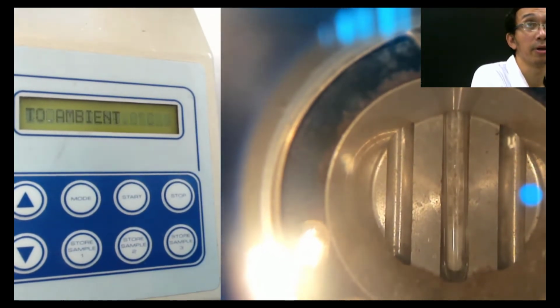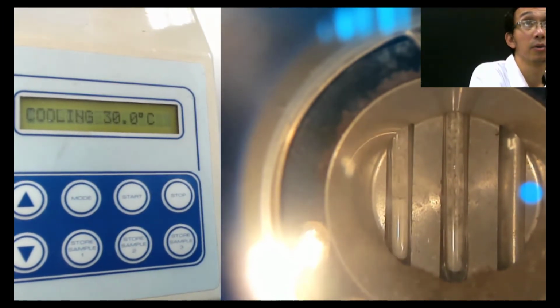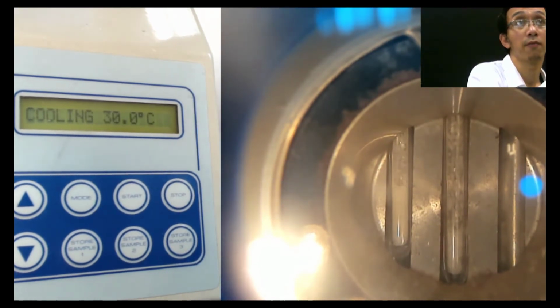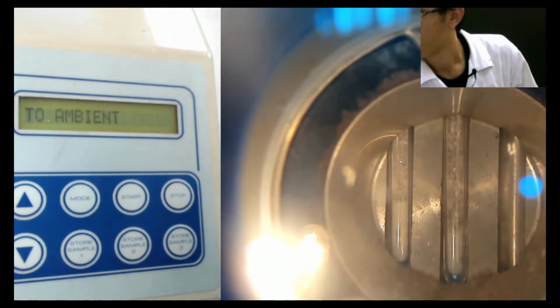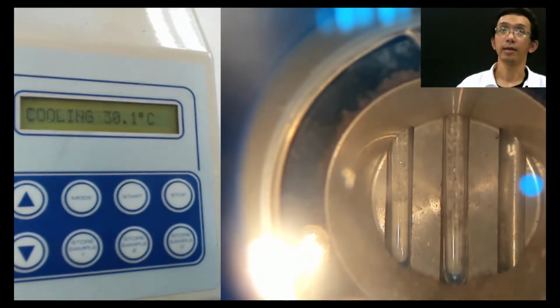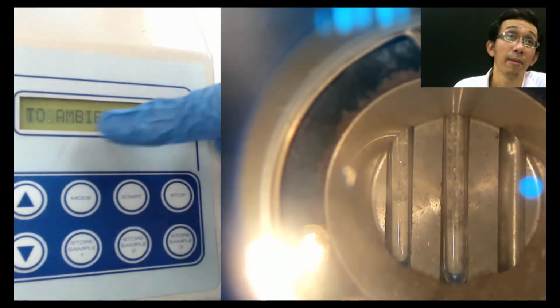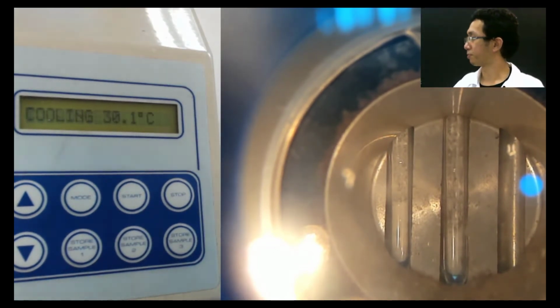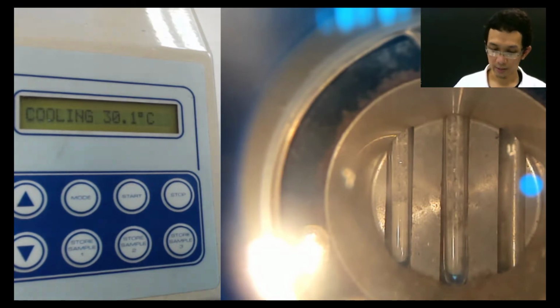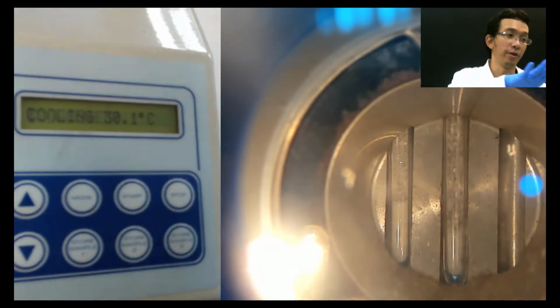So let me put the Y. So this is Y. So the Y is quite full. So I put a lot, but it's okay. Okay, I think you can see. So now the idea is this. I will ramp this thing. Now I will put it around 60, because if you look at our table 2.2, I don't want to move this camera again.